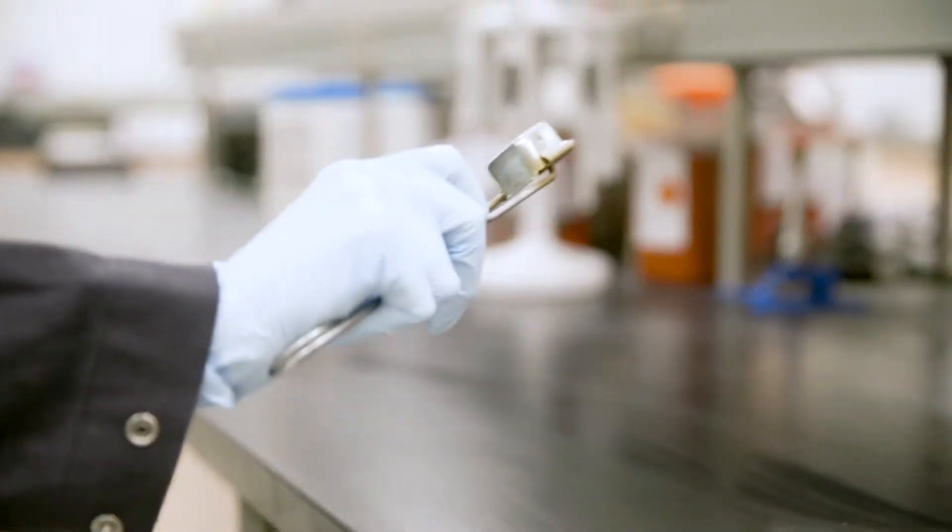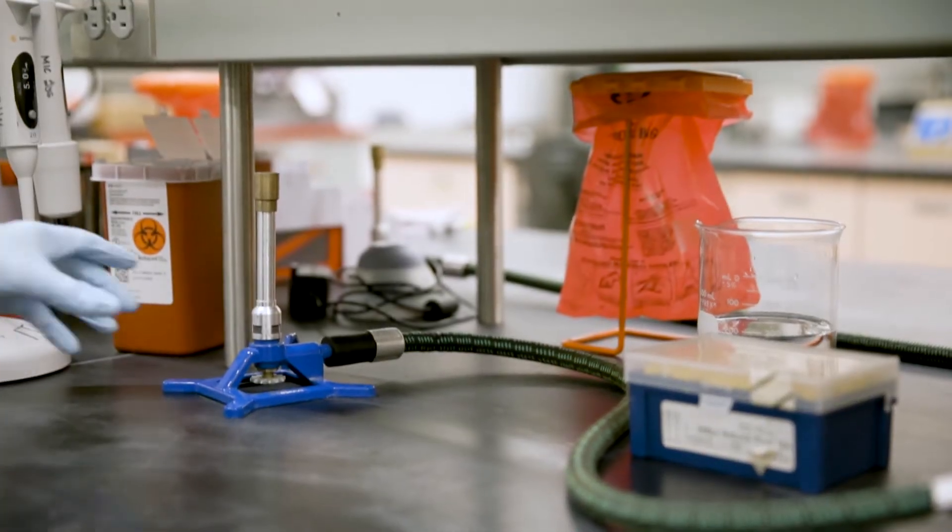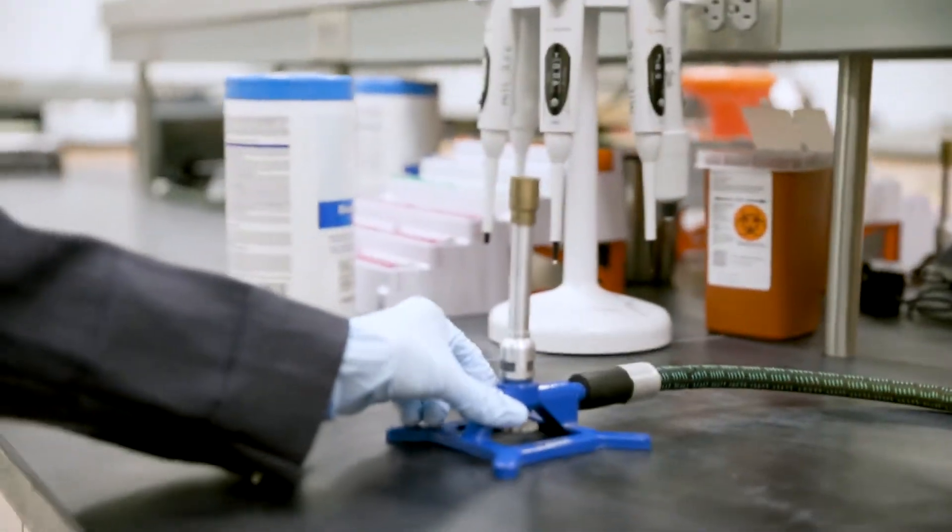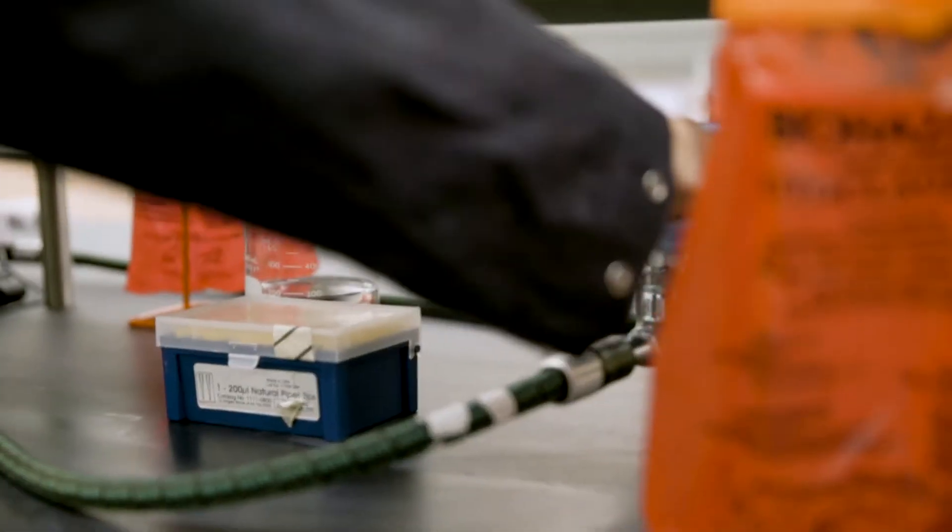Remove the striker from your lab drawer and test to make sure it generates a flame. Place the Bunsen burner directly in front of you and turn on the gas.